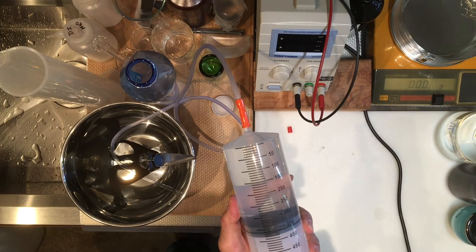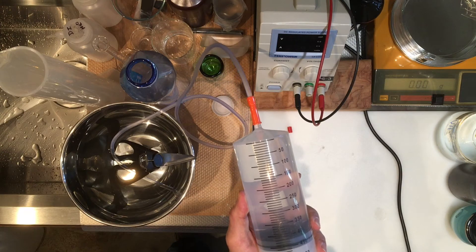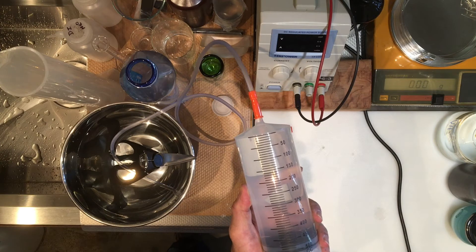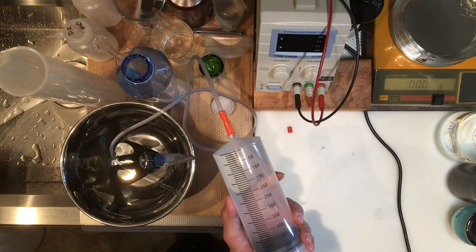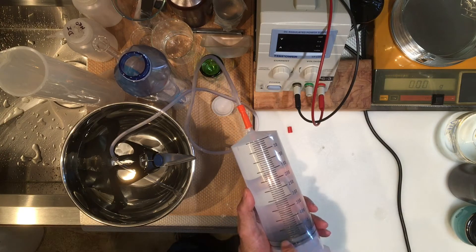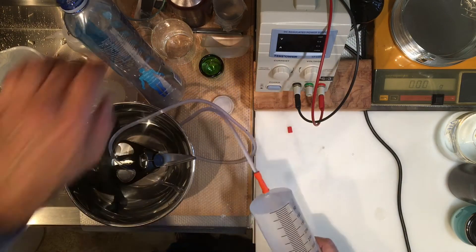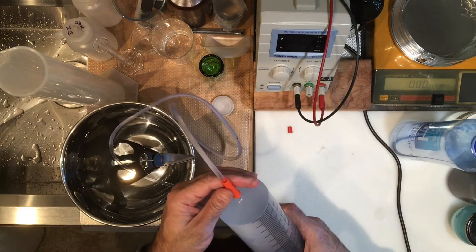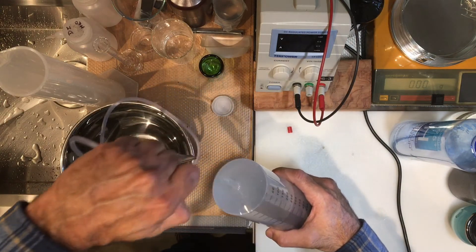Water takes more effort, I'm putting a lot of force on this. It's not as easy as sucking air into it. Okay, there you go. I am right on the black line here. The rubber is making a black line here and my black 500 ml mark line is just right on it. That's good. Now I'm gonna have this ready for the weight. Let's go ahead and take this off.